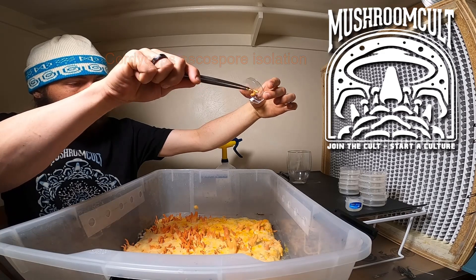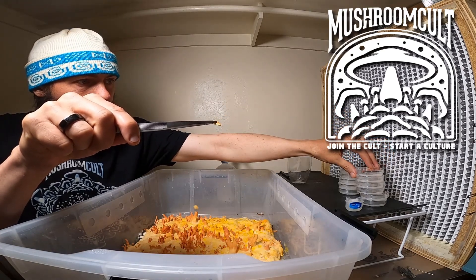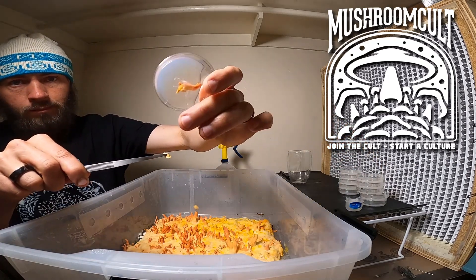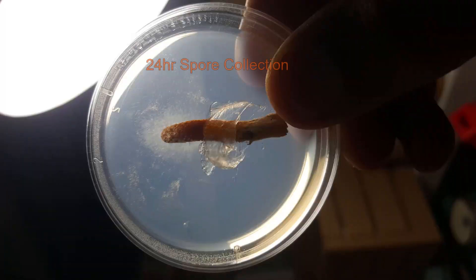These petri dishes have water agar in them, which will help reduce some of the contamination. You can see that it's stuck to the lid and that there's a gap between the mushroom and the agar.